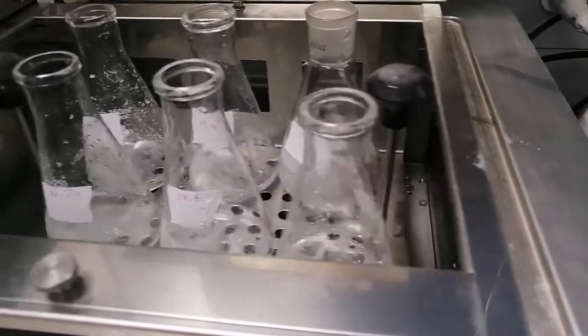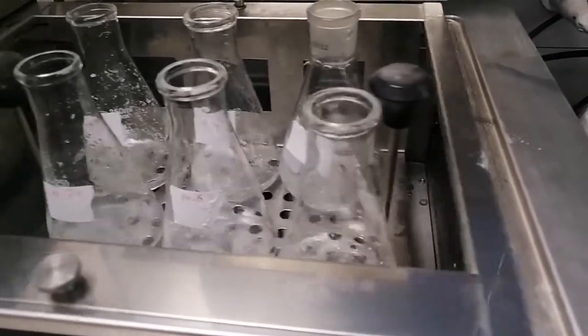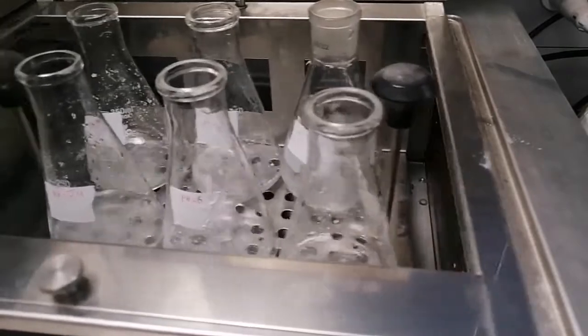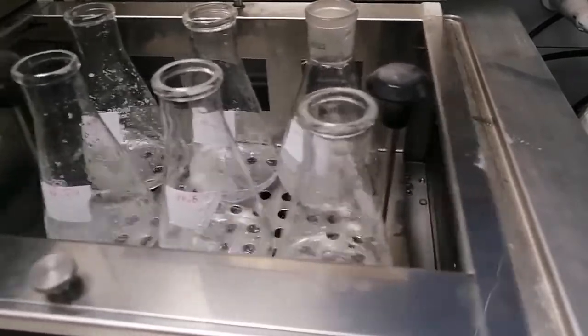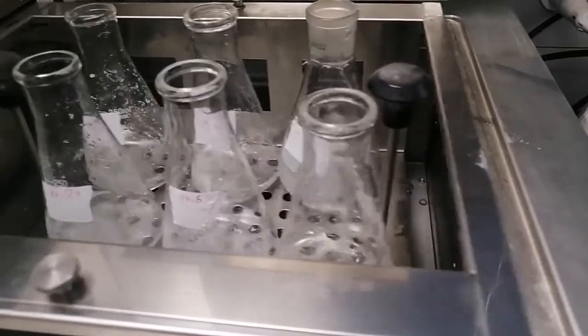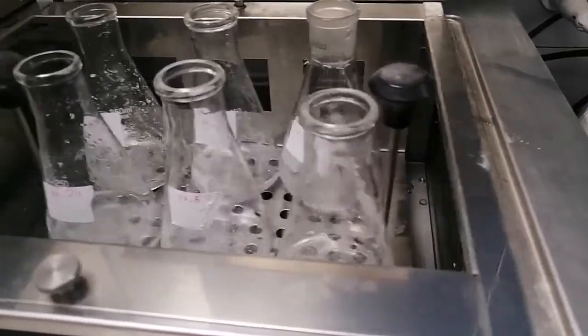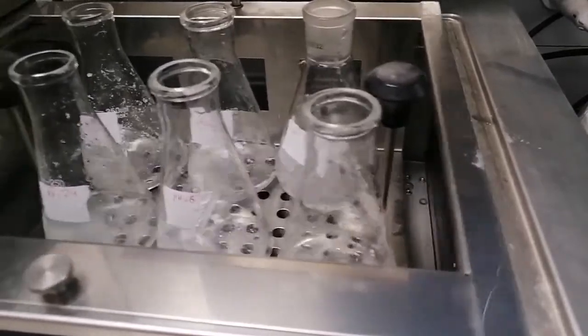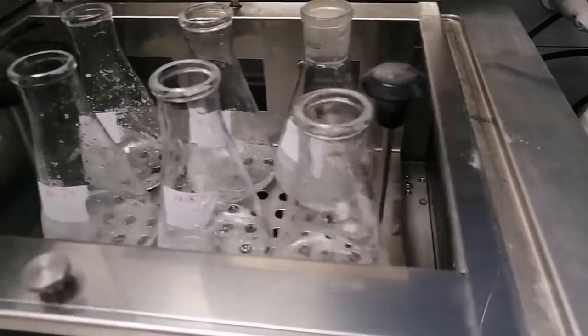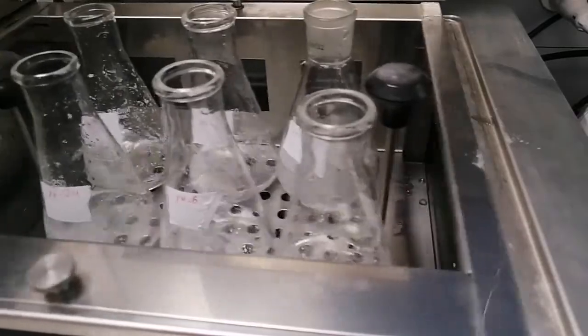During these 15 minutes, we will prepare calibration solutions in order to construct a calibration curve. We will have a 0.002% weight per volume of mefenamic acid in sodium hydroxide as a stock solution, and then we'll prepare further solutions in order to find the absorptivity of mefenamic acid at a specific lambda.